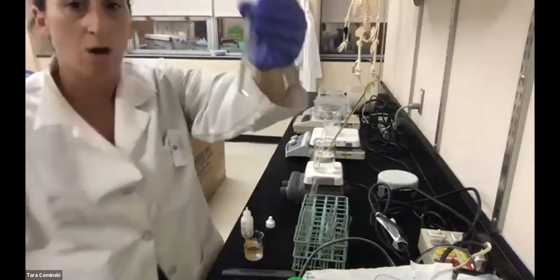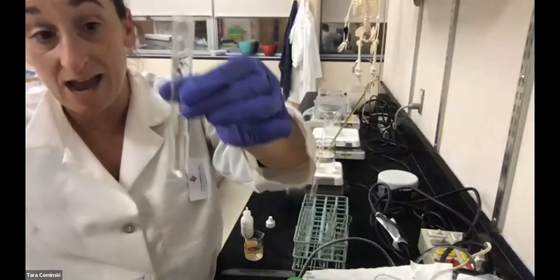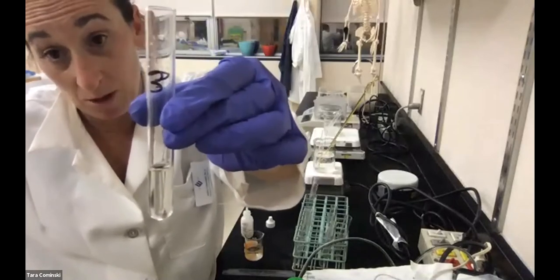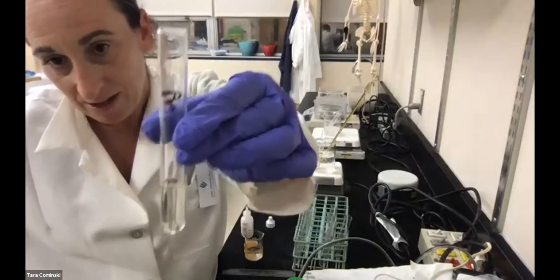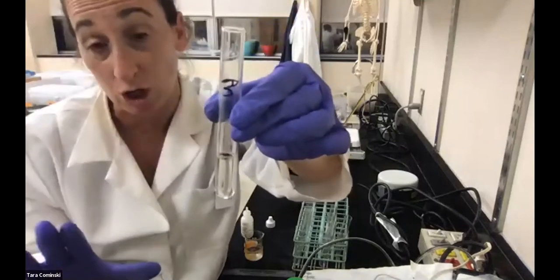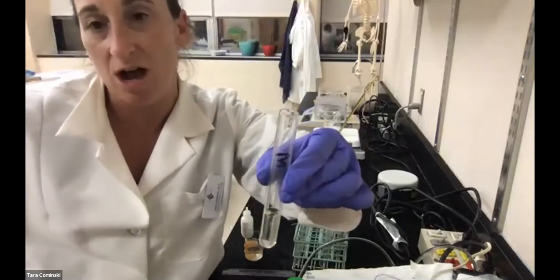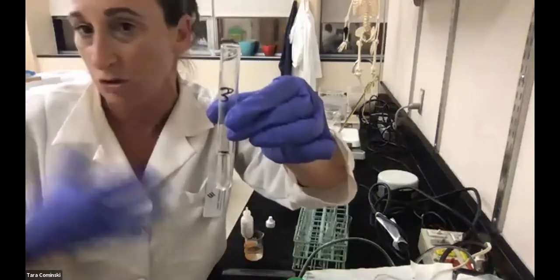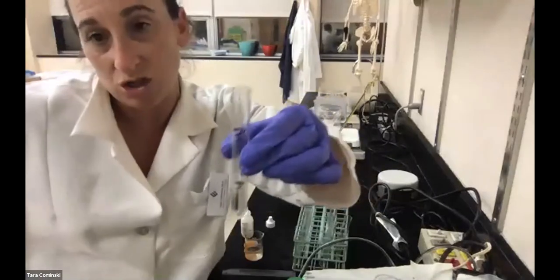All right, so I lied. Catalase, our enzyme, and sucrose, 0 millimeters in terms of bubble height. Why? Catalase cannot break down sucrose. The substrate for catalase is hydrogen peroxide. Therefore, we don't see a reaction occurring at all. Remember, the amount of bubbles is an indication of the activity of the enzyme or the reaction that's occurring. If there are no bubbles, there's no reaction. Why? You need an enzyme and a substrate in order for that reaction to occur.